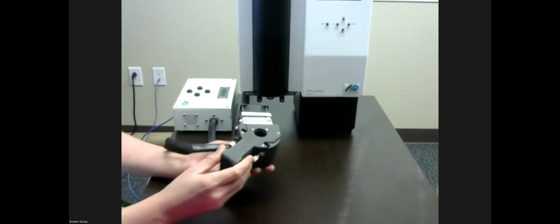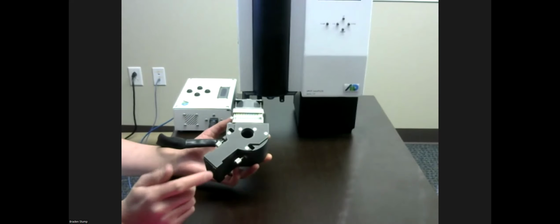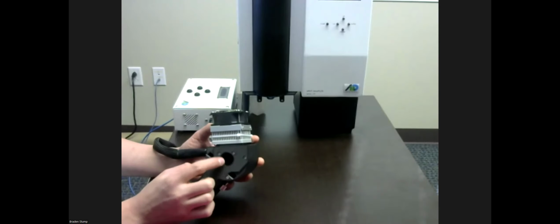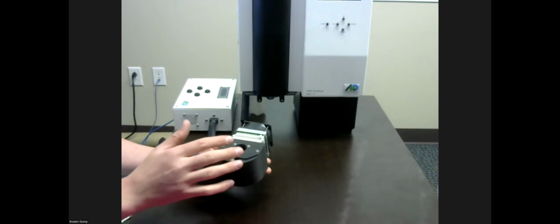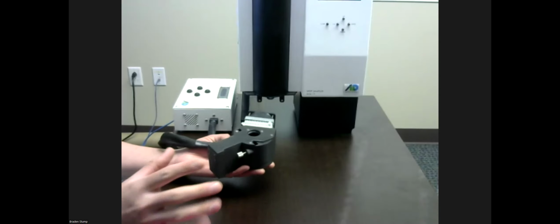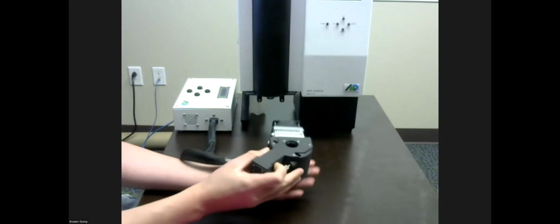So the other thing that you will see is this is a TLC. This is the cooling sleeve unit as well as the camera unit. There is a Raspberry Pi camera embedded right here, and then small lights and a cooling sleeve with a Peltier cooler and fan coming out of this end. And the idea here is to cool the vial to a set temperature that is convenient to modify your moderator temperature around, but also is generally a static temperature to make sure that your changes in moderator work properly, even in different ambient room temperatures.